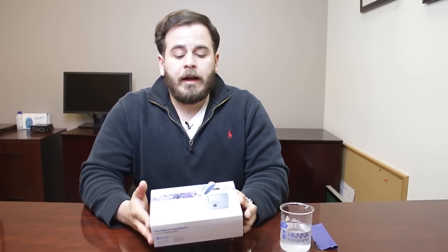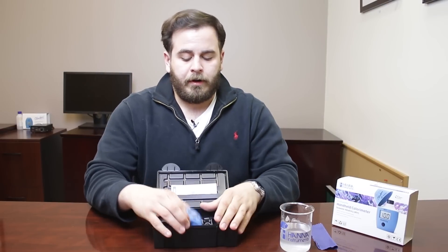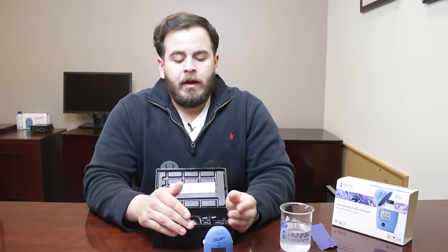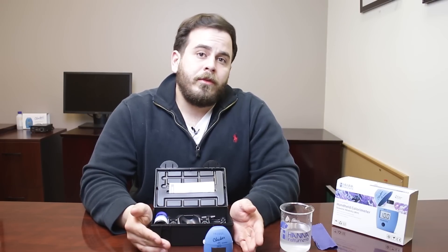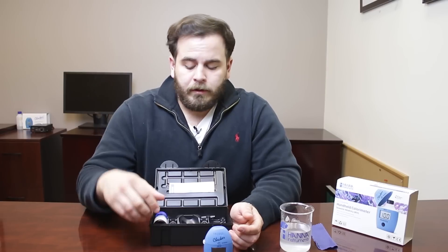If you're going to get a DKH checker, you get everything you need to start testing right inside the box. That includes the actual meter itself — the HI-772 DKH alkalinity meter — which is a handheld colorimeter. That's a type of photometric device that uses light to measure absorbance rather than you trying to match a color to a chart. Compared to other alkalinity test kits, there are no drops to count, no colors to match. It's really precise, accurate, and an easy way to measure alkalinity.